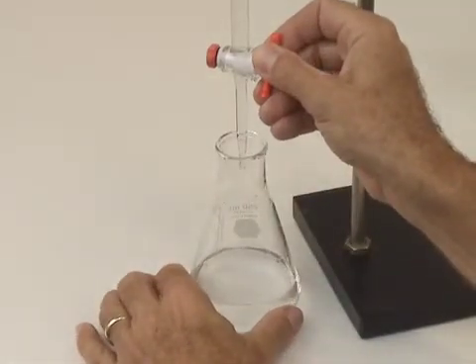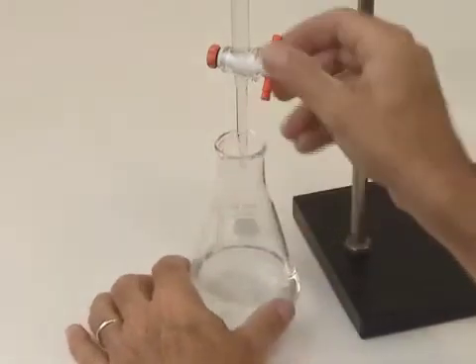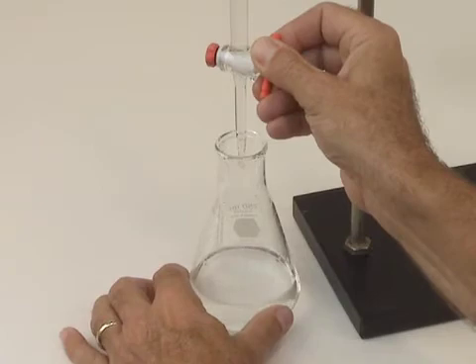When we are very close to the end point, it is time to add single drops and even half drops to the solution. You should adjust the stopcock so that only small movements turn it on and off.